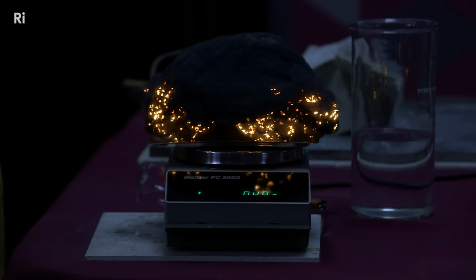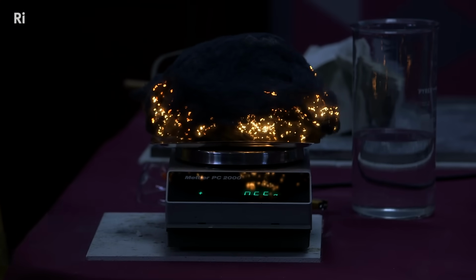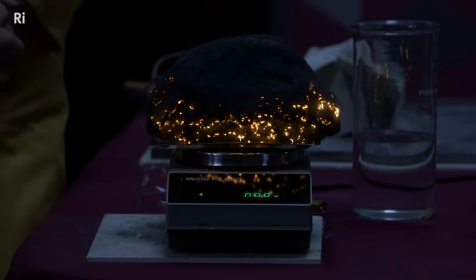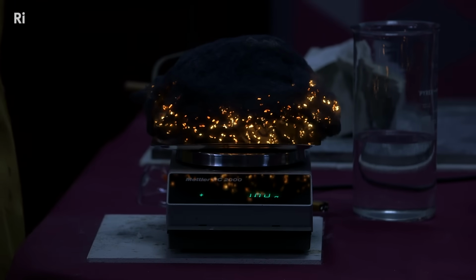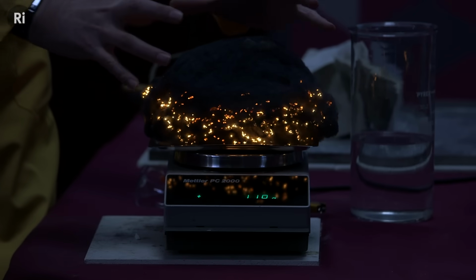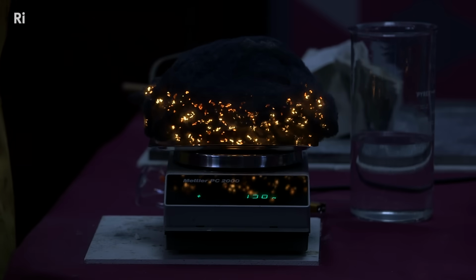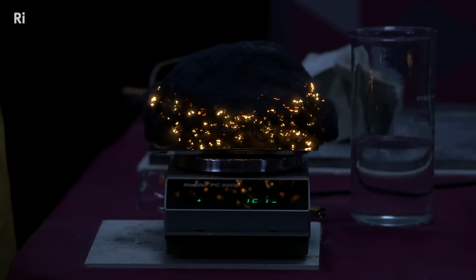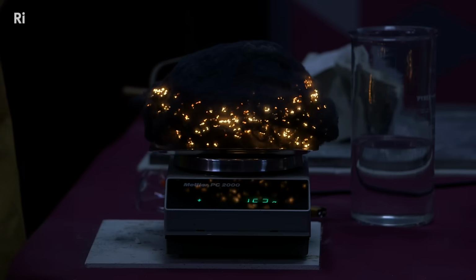Okay, now why is this? Well, we can certainly see the light, and I can feel the heat very nicely here. And it's probably this heat that's given out, it decreases the density of the air that's trapped in here. That's probably why the mass went down initially, just as it became a little bit less dense, the air there. But it is actually going up.